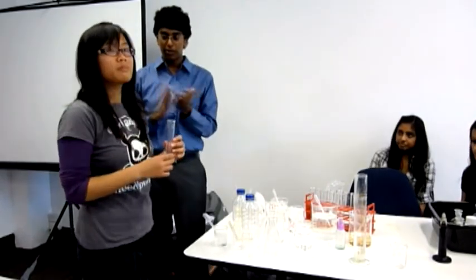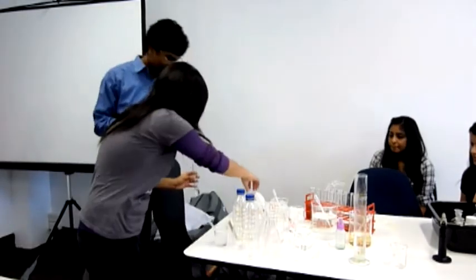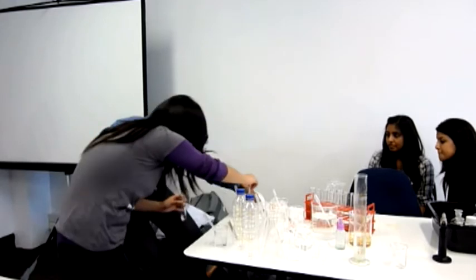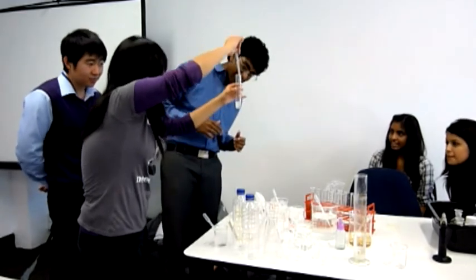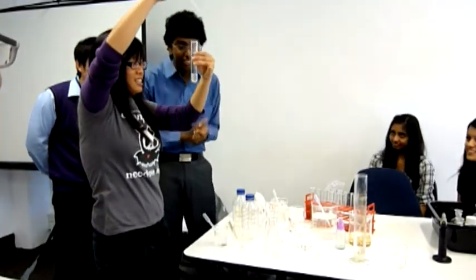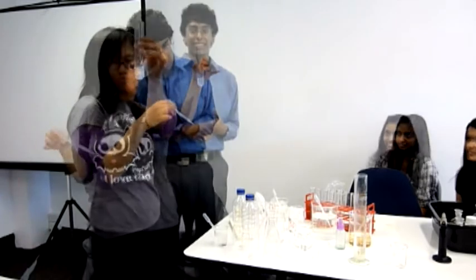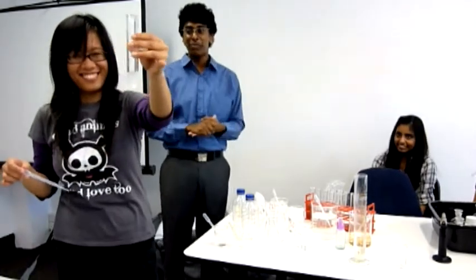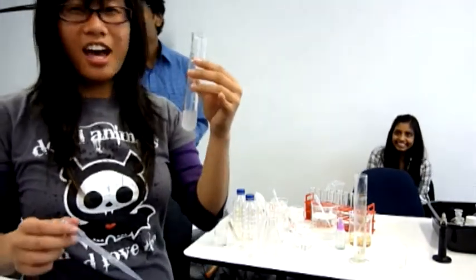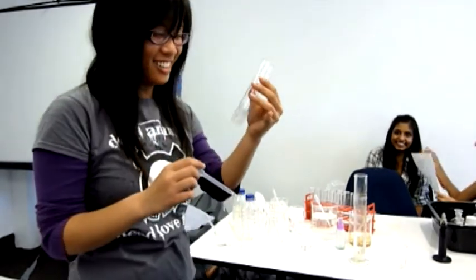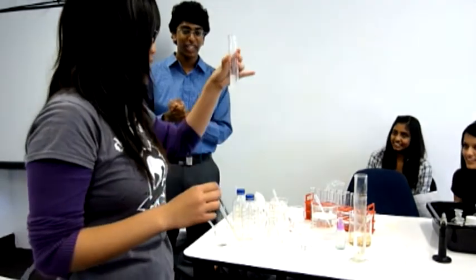What do we add to test for sulfate? Barium nitrate, go for it. We should see some instant change if it's there. Can you see it, the cloudiness? Now it'll start separating out, hopefully. A bit closer. Are we all good with that? White. Are we filtering this one?